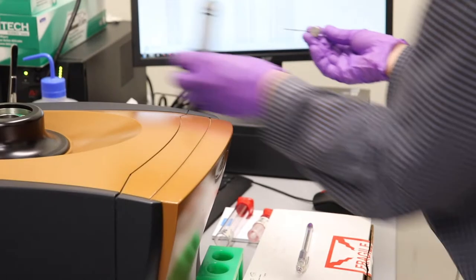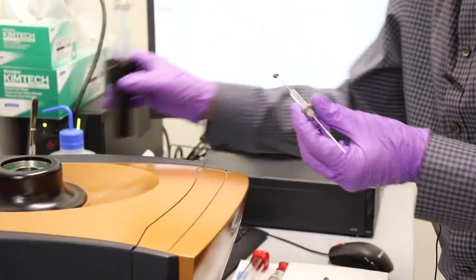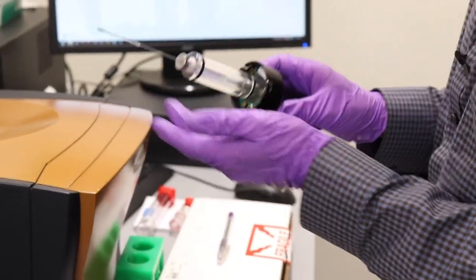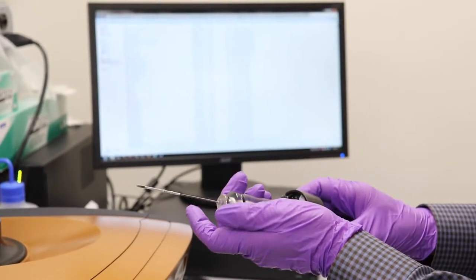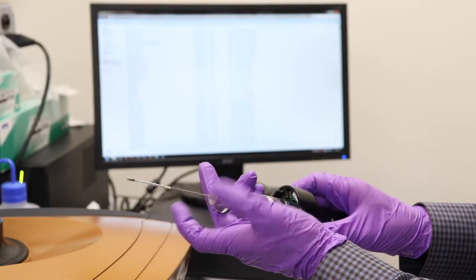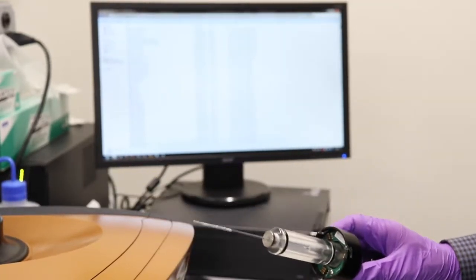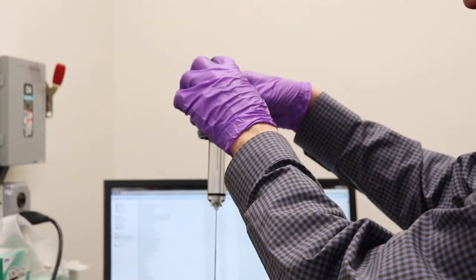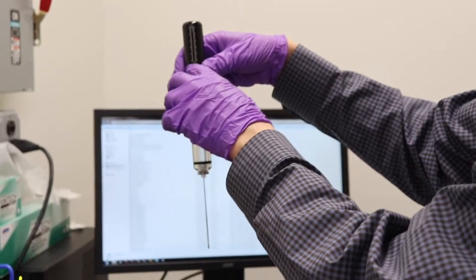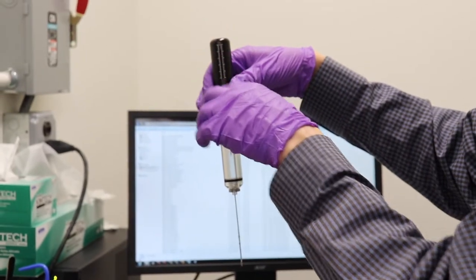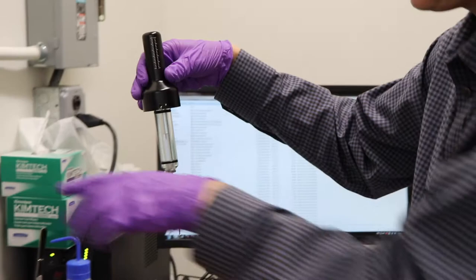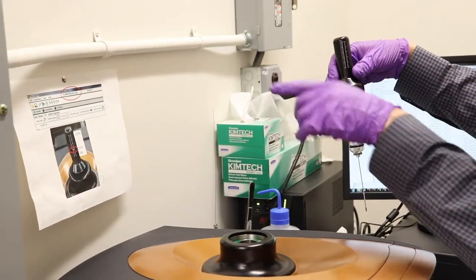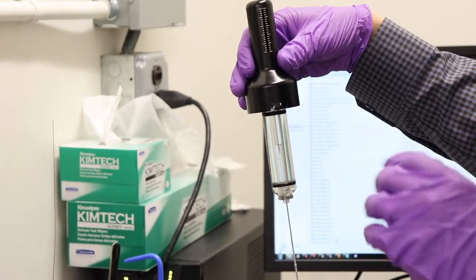I'll take the burette holder. Carefully place it in there. And as you screw it on there, and it's the same thread as in the storage case, as you screw that in there, you're going to push that two or displace that two microliters out of the end. Get that little bit of liquid off, and you're ready to put it in there. So there is a gradation on the front that shows how many microliters, or the percentage of volume that's still in the titration syringe. That should match, if we look over here, there's a screenshot of the software, and where this, there's a little white level. That should match what the software thinks it is. If it doesn't, that means it got stuck for some reason. Happens very rarely, but keep an eye on that.